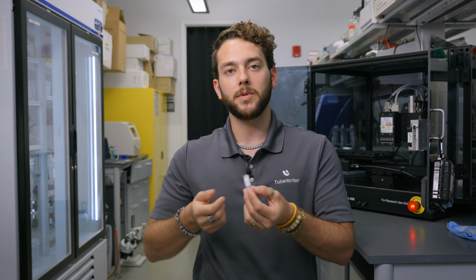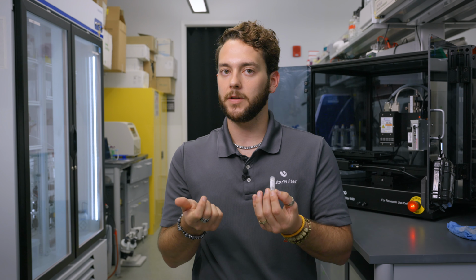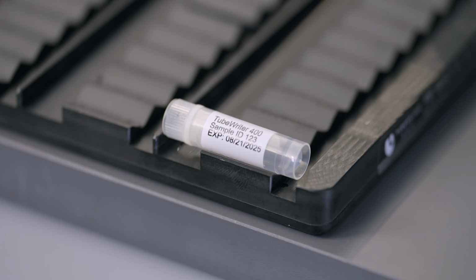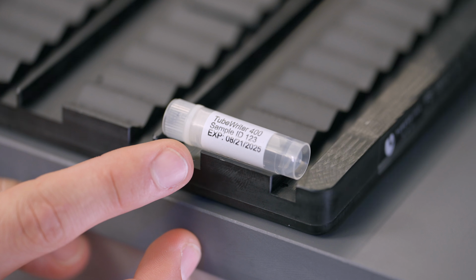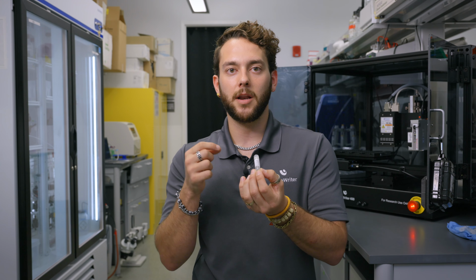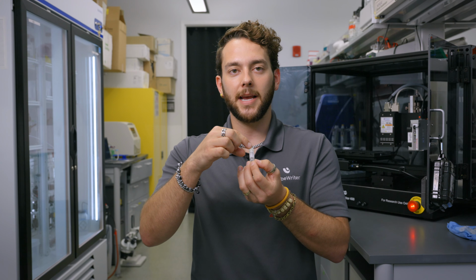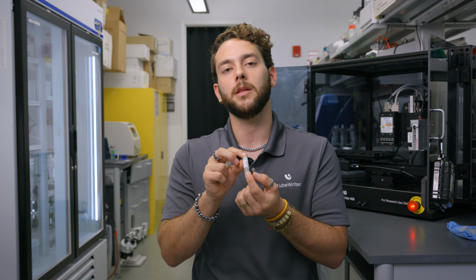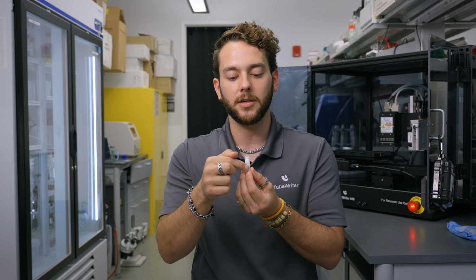Obviously, all of these tubes are rounded, they're a curved surface, but the goal is to get our prints to be as centered as possible so we're not too close to the hard curves of the bottom of the tube or the top of the tube, because if you're too close to that hard curvature of the tube, that text is going to start to spread and warp and may not look as crisp and clean as it would if it were centered directly in the middle of the tube. And that was how you adjust the Mediafile settings, specifically the print location of your samples.